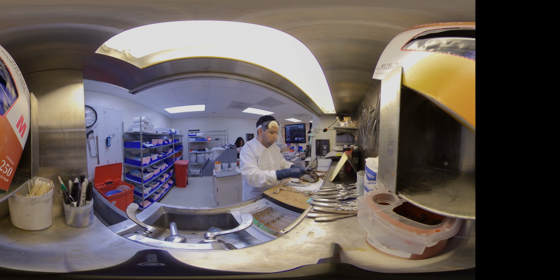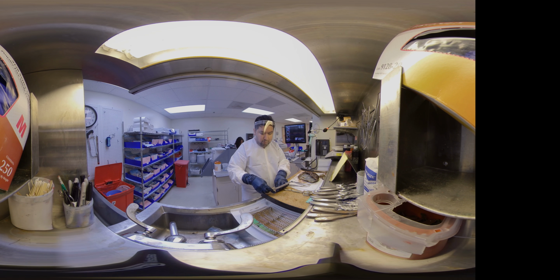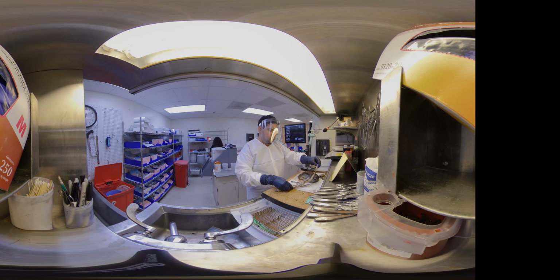The umbilical cord is white-yellow, trivascular, measures 41.5 centimeters in length and ranges from 1.2 centimeters near the placental end to 1.6 centimeters near the fetal end in diameter. Approximately 2 coils per 10 centimeters are present on the cord. The cord has an eccentric insertion, which measures 2.5 cm from the nearest placental margin.